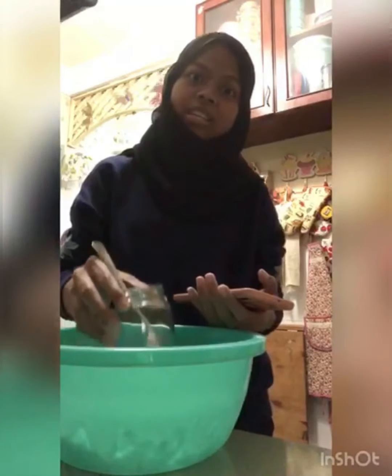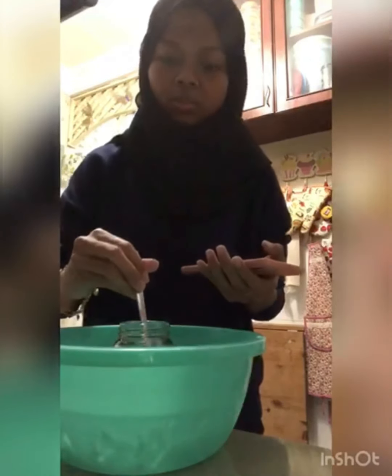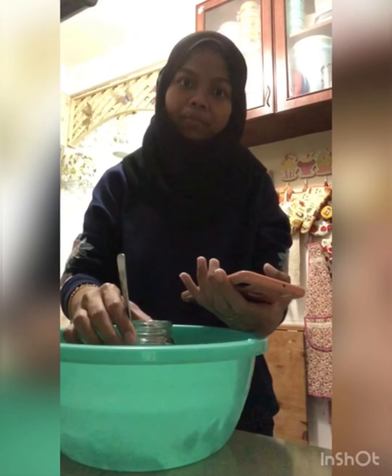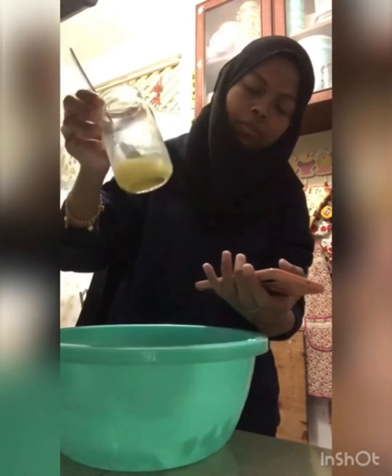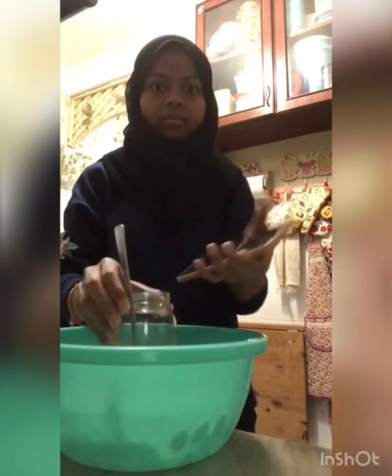In addition, when cloudiness is formed on the side or bottom of the glass, we need to stop the stopwatch and stop stirring the sample. Stop the stopwatch and stop stirring when it is cloudy. Lastly, show the result of the oil becoming cloudy.